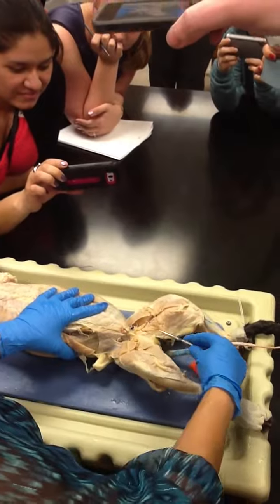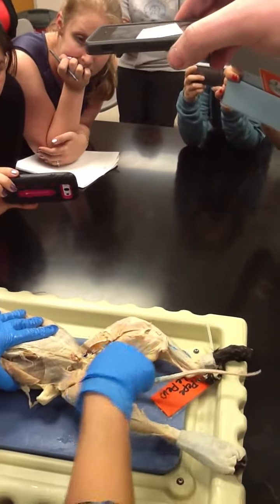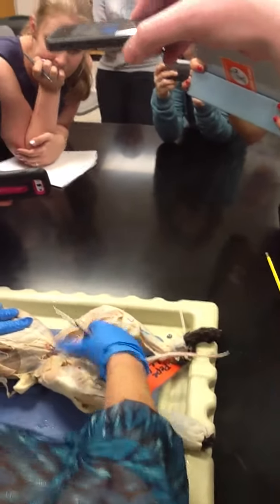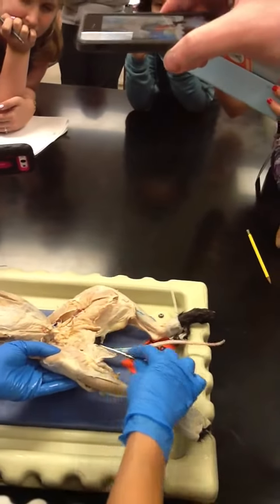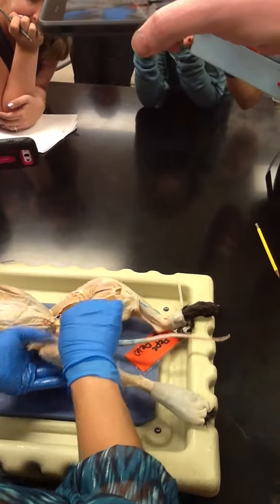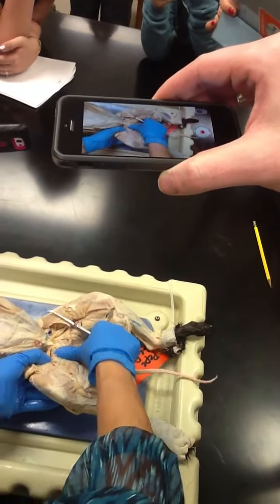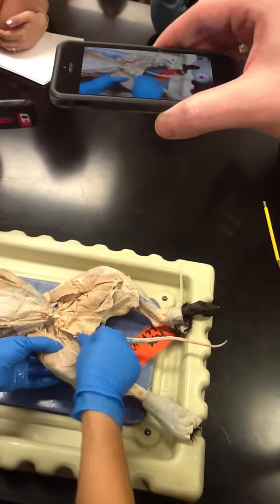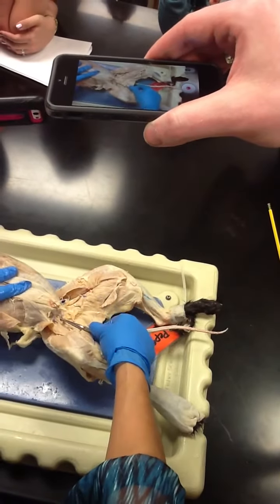Again, the muscle that's close to the groin is the gracilis, and this is the sartorius. If we open the gracilis up, the very first big huge muscle you see is the semimembranosus. The next big muscle right here is the adductor magnus or adductor femoris. The next one is the adductor longus. The pectineus is way up there.